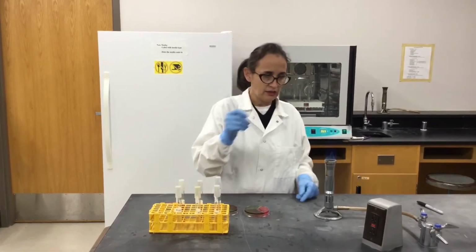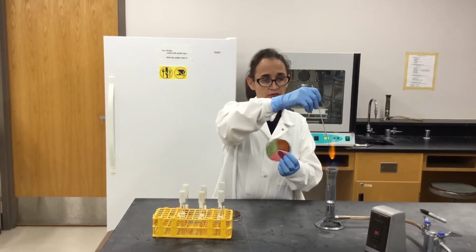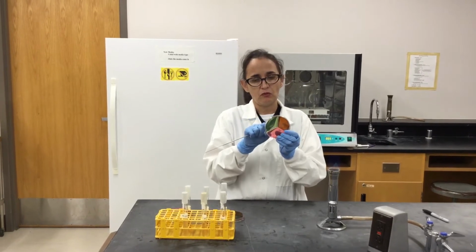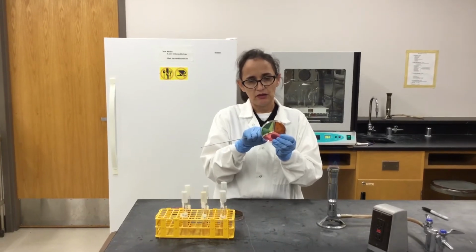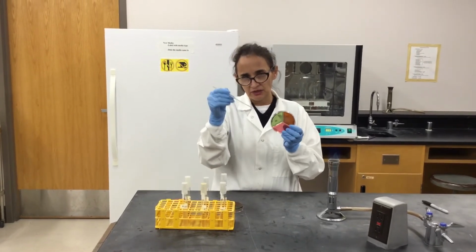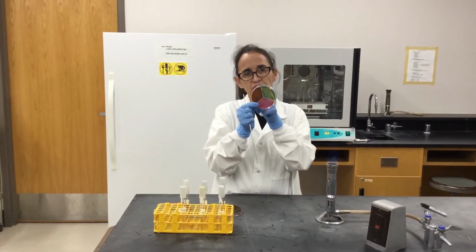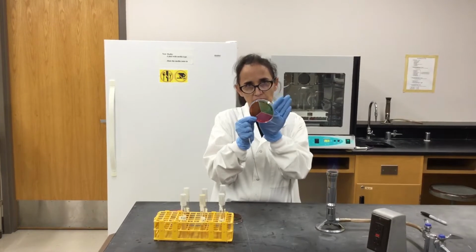So then inoculation for these segmented petri plates, which is very convenient when you want to perform several tests in a single plate, and then you prevent the bacteria from going from one type of media to the other one, and you can use the same type of media as well. So not necessarily you have to have 2 different types of media. And I'm kind of giving some explanation while I'm waiting for this to cool off. But anyway, since you have these segments that you can see here, there will be a physical barrier, like a piece of plastic, that prevents bacteria from going from one area into another one.